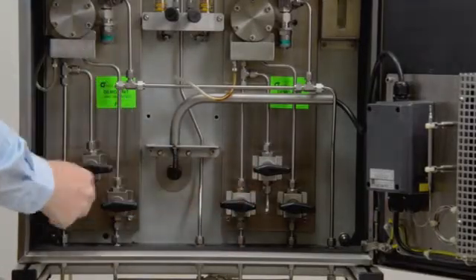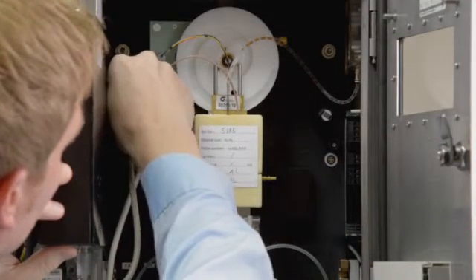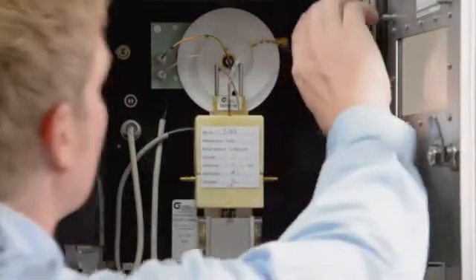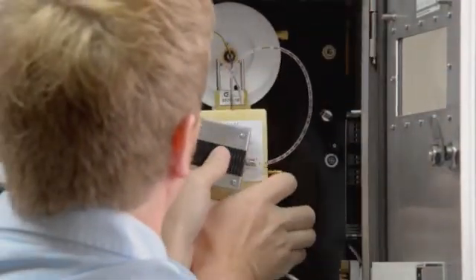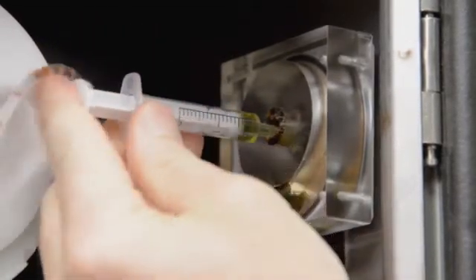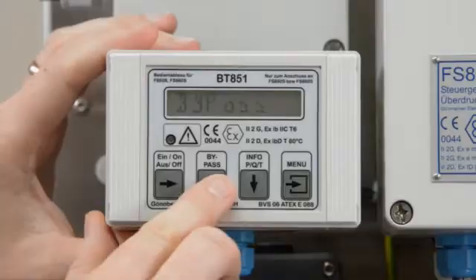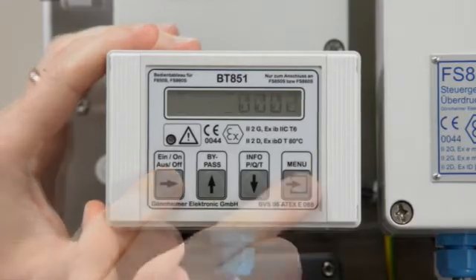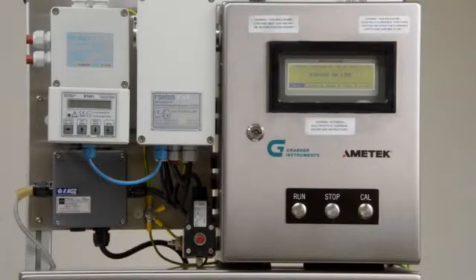Press the on-off button on the mounting plate to switch off the analyzer. Close the valves on the SCS. Disconnect the five plugs from the mounting plate and controller. Take down the oiler and the cell. Attach the new cell. Refill oil if required. Press the on-off button on the mounting plate, then activate the purge control, then press Run to start the measuring cycle.